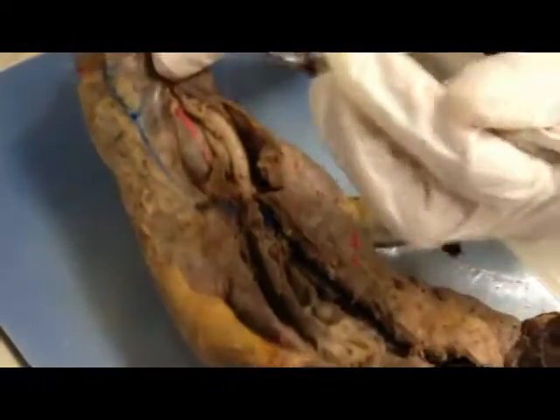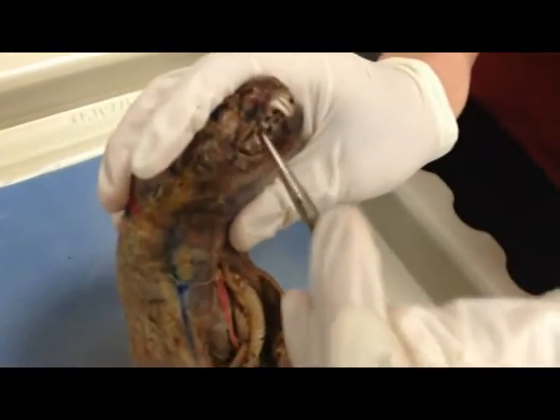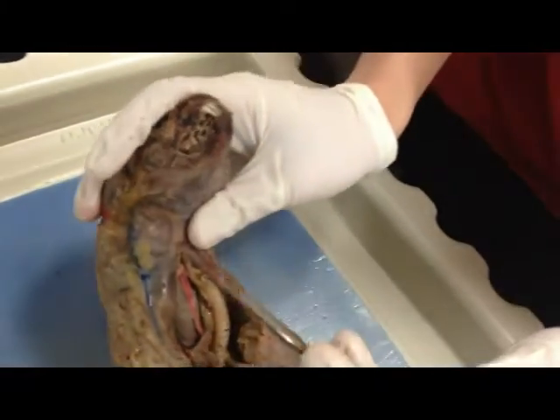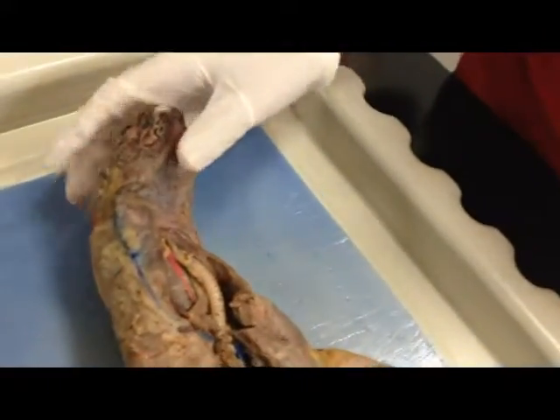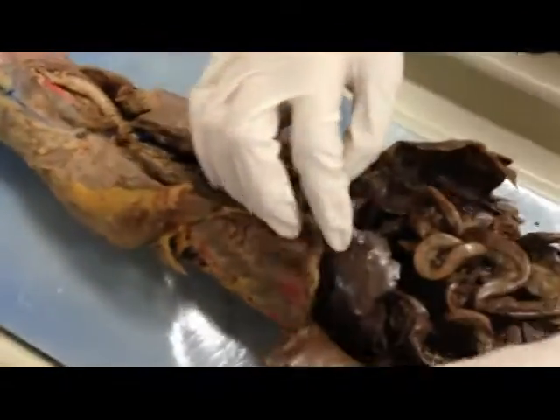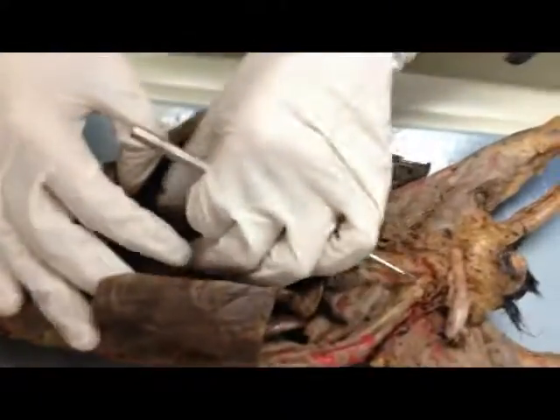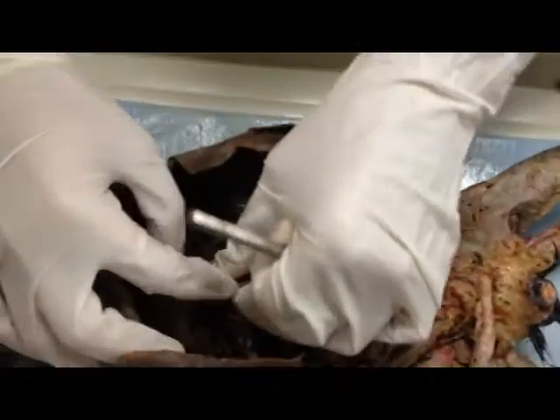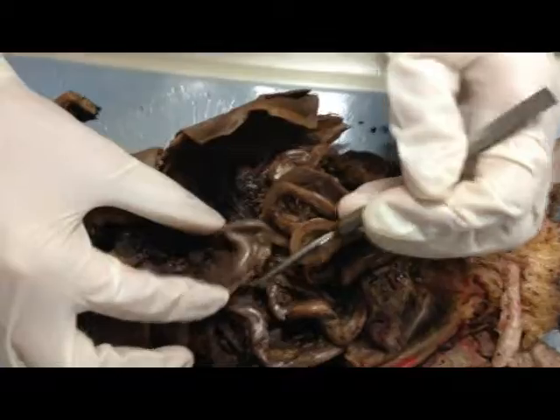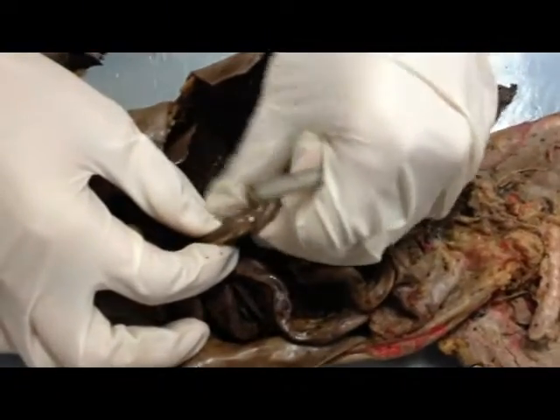You have the tongue, which of course is in the mouth. And here you have the stomach — this right here should be the stomach. This is the stomach because it has this big fat portion right here.